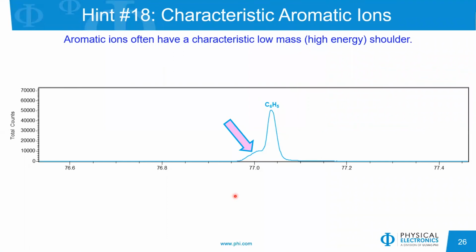When we're looking at polymers, it is pretty characteristic also, when you're looking at some of the monomer units, that you will see a shoulder on the low mass side. Again, this is due to decomposition of the ions. In this particular case, the decomposition is happening in the extraction region, and so these decayed ions have a slightly higher kinetic energy than the main peak ions, and so we see this shoulder at lower mass. So this is not an uncommon observation.